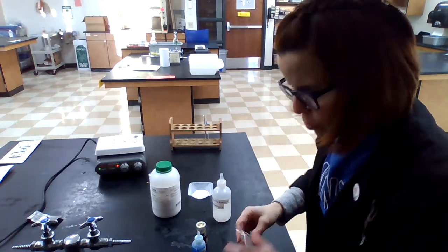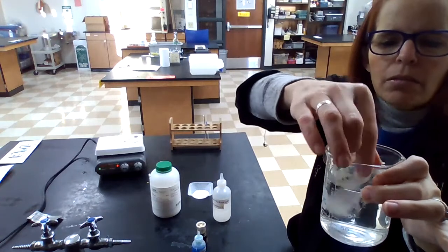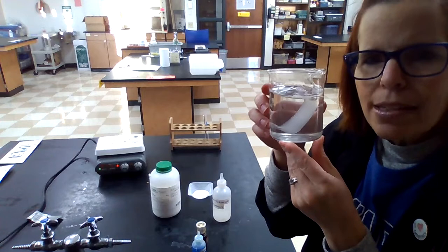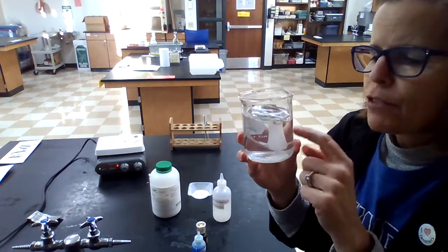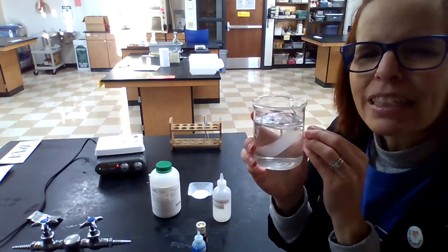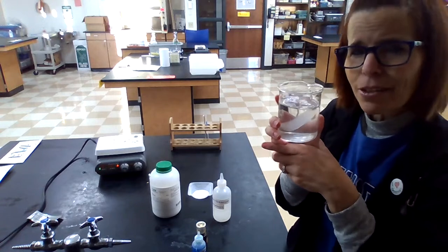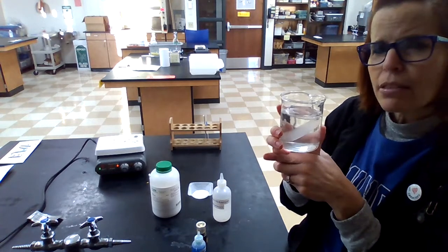We've got sugar and starch. What we're going to do is put this baggie in a beaker and let it sit for 10 minutes. It's very concentrated inside the baggie, so whatever is inside — if it can get out into the water — it should diffuse out into the water. Then we're going to test the water to find out what escaped out of the baggie.